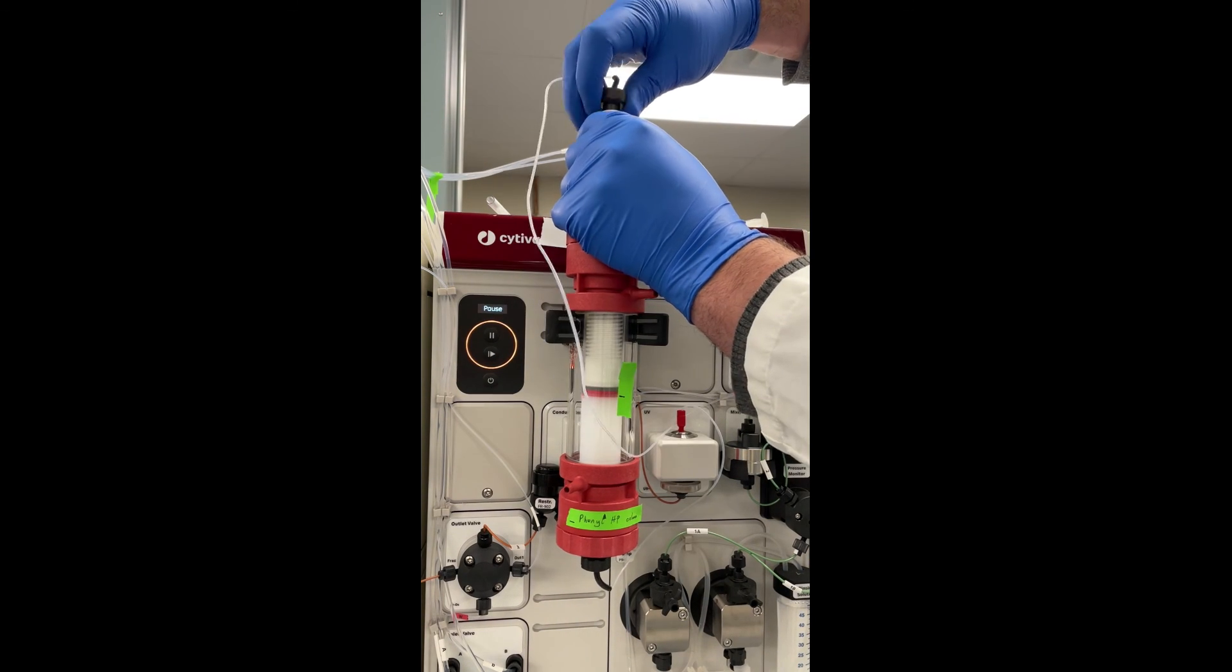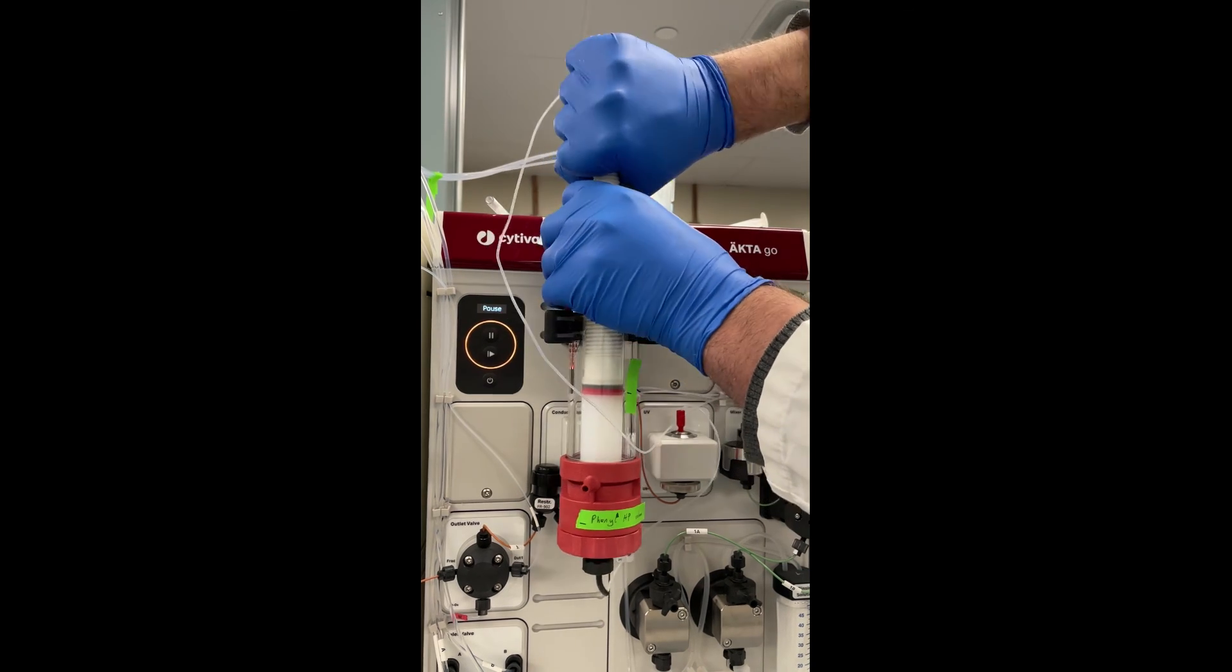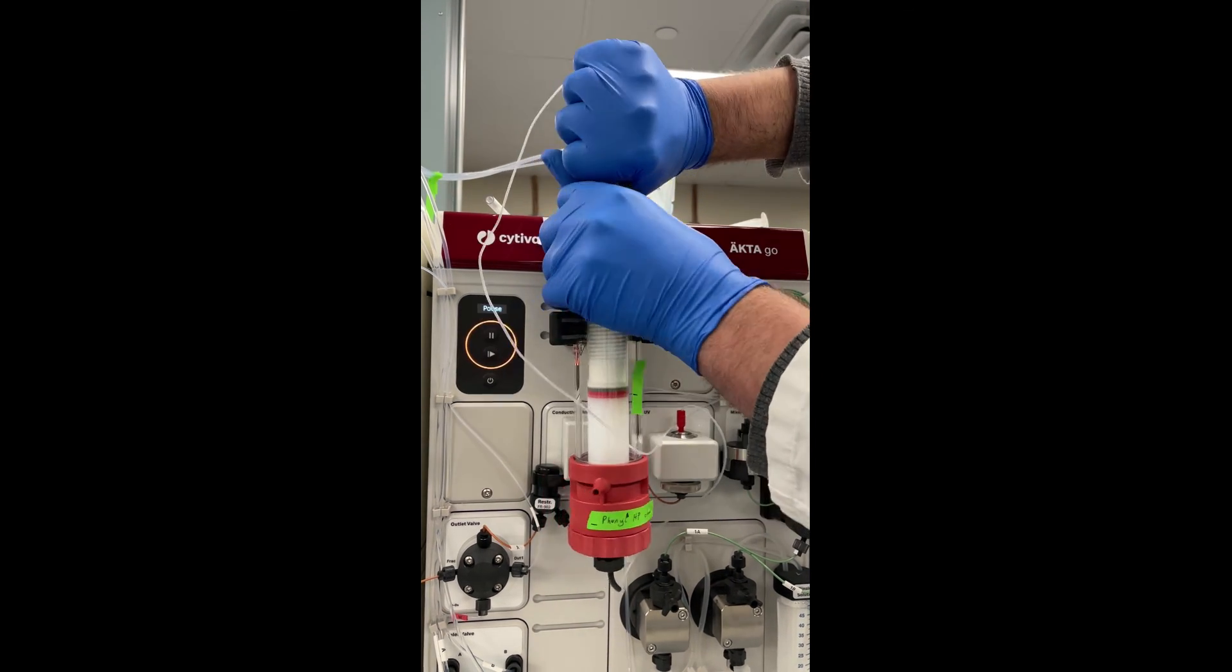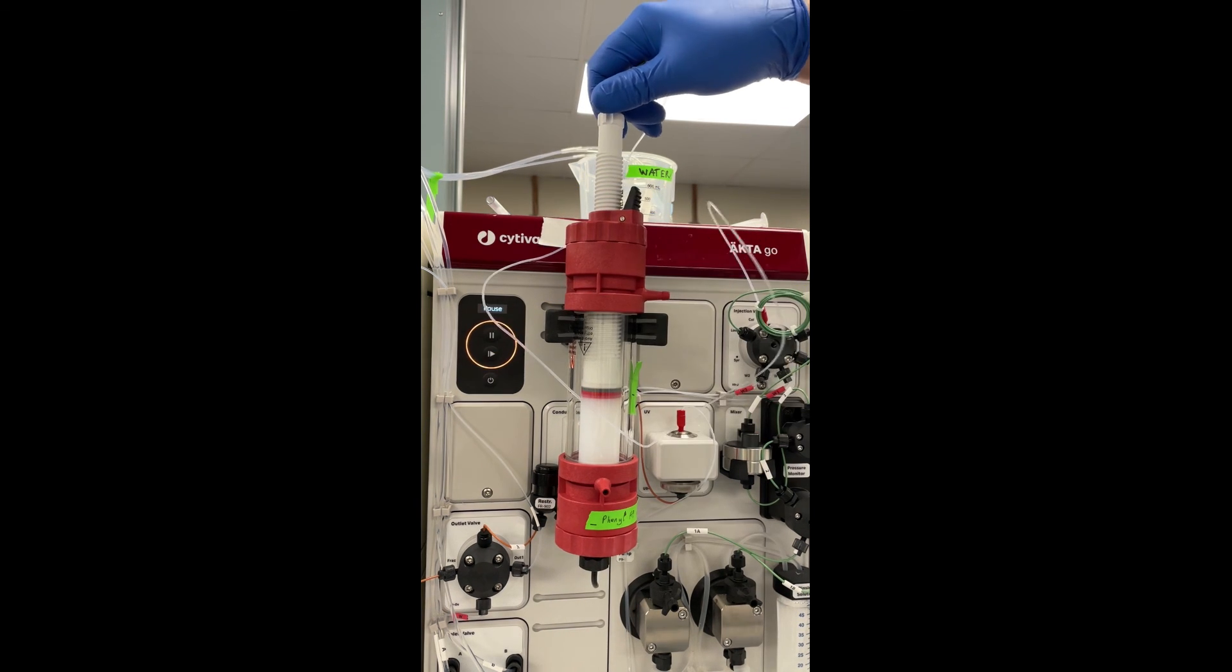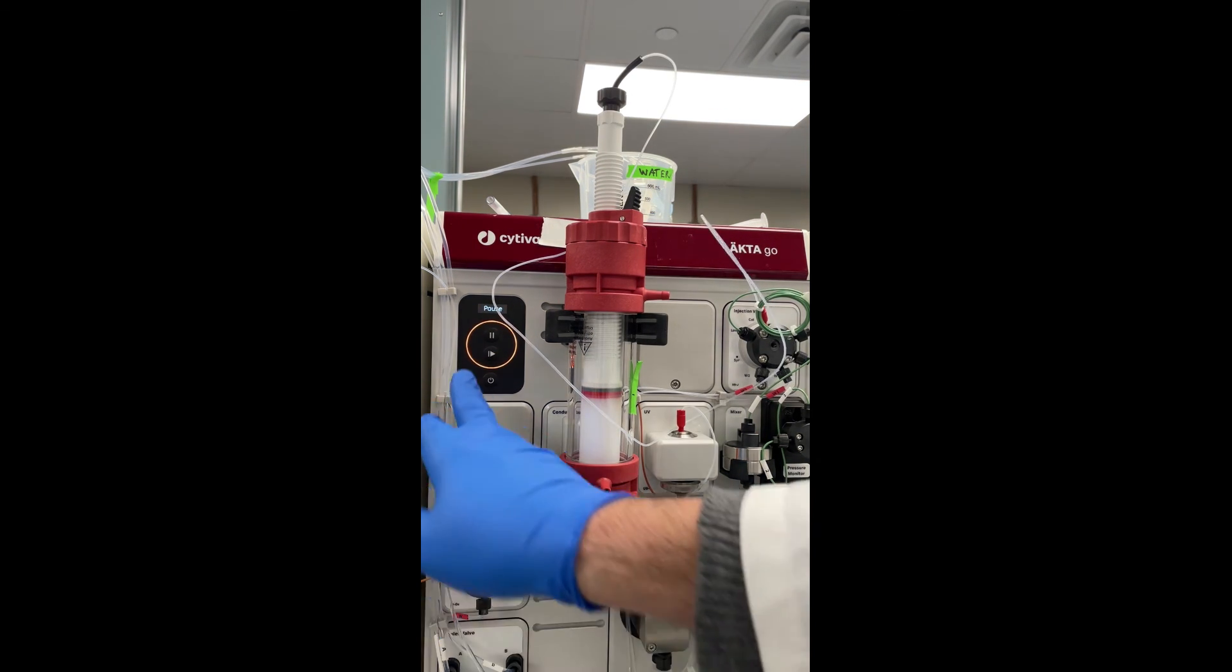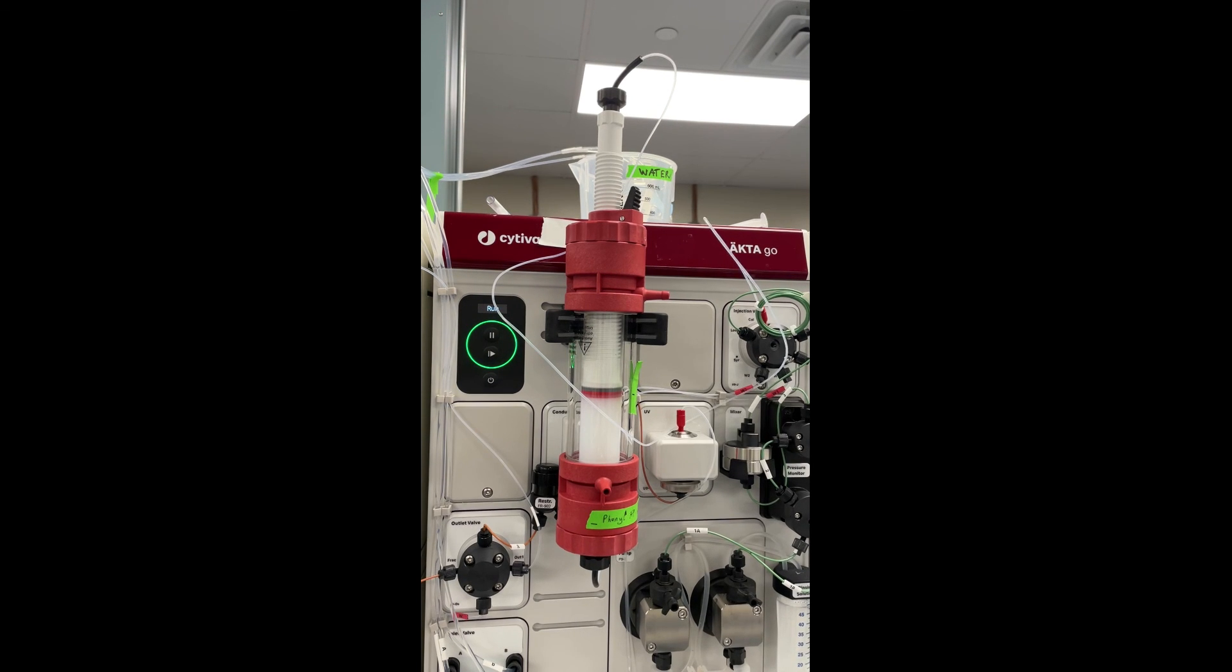So I did pretty much the same thing as before. Paused the system, loosened the nut on the top, and then cranked down on the upper adapter just a little bit more. And I think I compressed it just another millimeter or two, which is exactly what I was looking for.